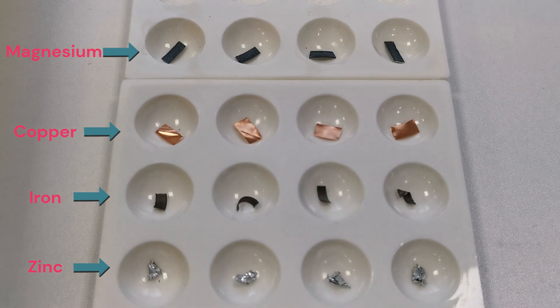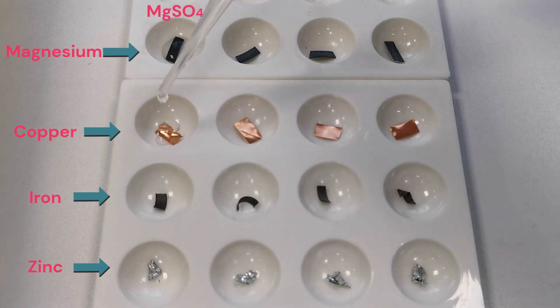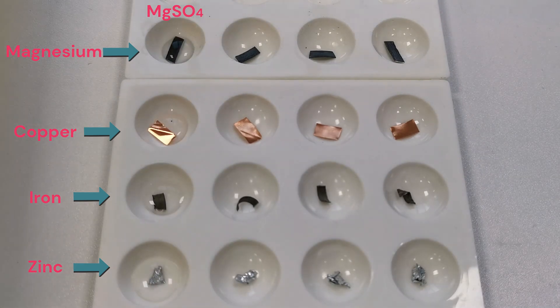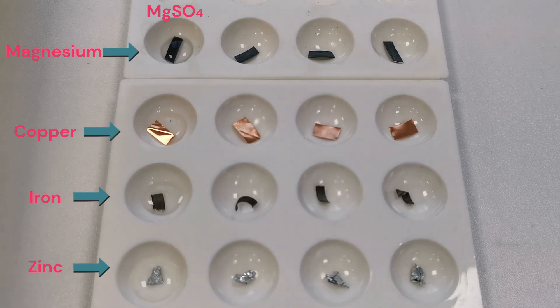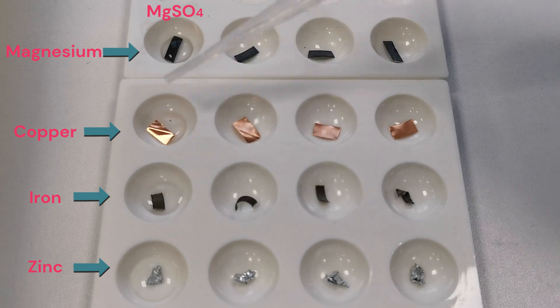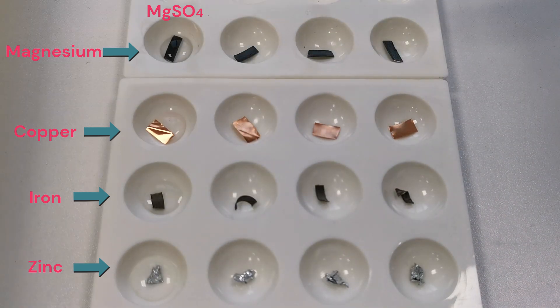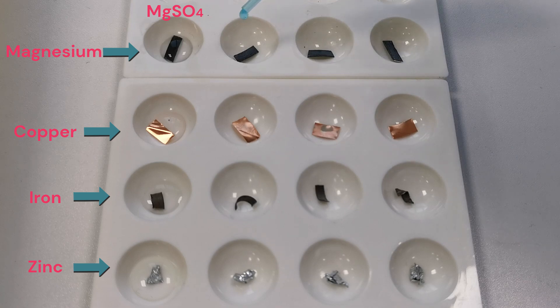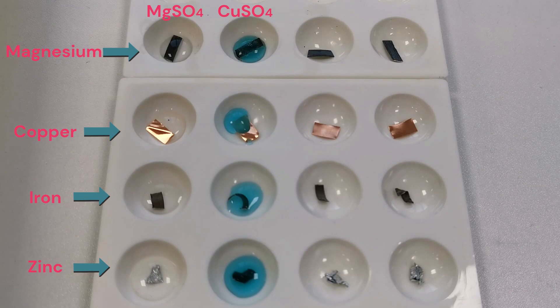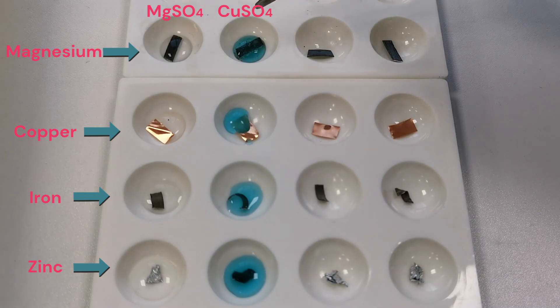The first solution we're going to add is magnesium sulfate, and as you can see there are no reactions occurring. The next solution we're going to add to the metals is copper sulfate, and as you can see the magnesium is reacting with the copper sulfate.